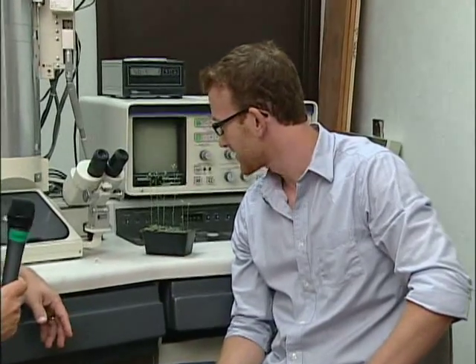So students in first-year biology have been using dissecting scopes as well as compound scopes that get down to a 40 times objective and a 10 times objective for about 400 times magnification. What would be the endpoint magnification of this particular instrument? We're looking at actually tens of thousands of times magnification. We're able to see individual organelles such as the Golgi apparatus and mitochondria as well as the nucleus. We're able to see how these different structures are placed within the cell in order to carry out basic biological functions.